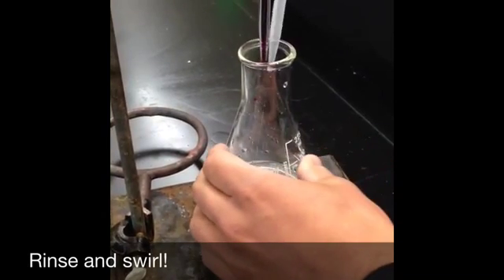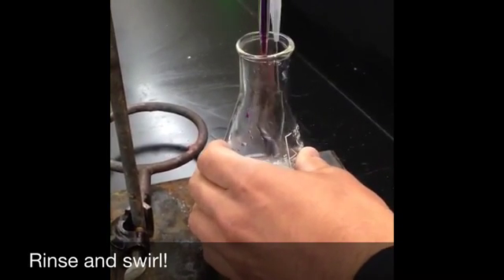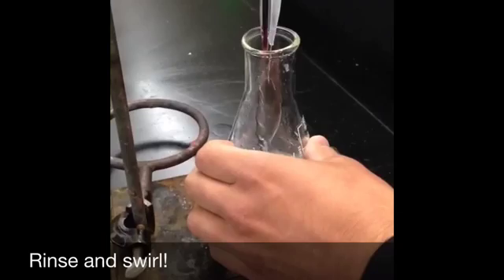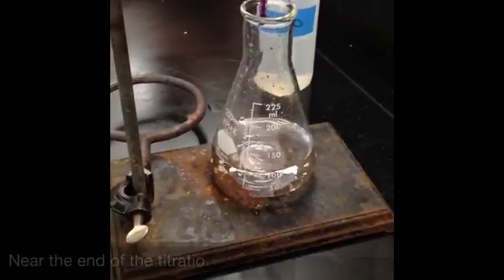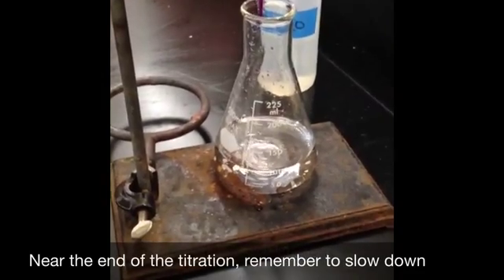When potassium permanganate is on the sides of the flask, you have to rinse and swirl to make sure that all the potassium permanganate reacts with the hydrogen peroxide. This will not change the concentration of the solution.